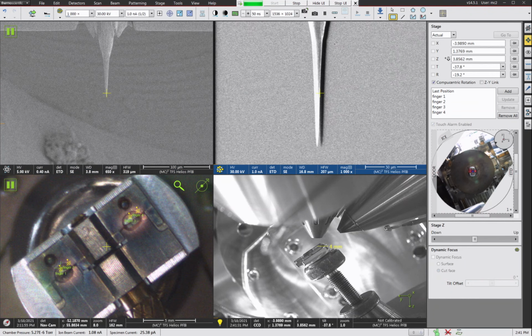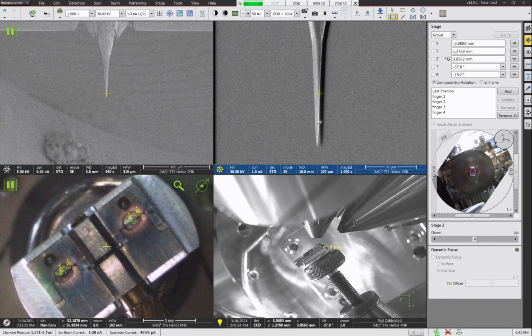So if you're looking at your FIB image like this, keep in mind that the axes haven't moved around. So if I double click on the end of the post right now, I'm going to cause the microscope to slam my sample holder into the FIB column, because the software interprets a double click down here as trying to move in the Y direction, but it does a tilt correction on it. So it basically tries to move it in, it's like a divide by zero error. So it tries to move it an infinite amount of distance towards the column. So don't double click on the FIB image when you're at the minus 38 or 37 degree tilt. You're likely going to screw everything up.